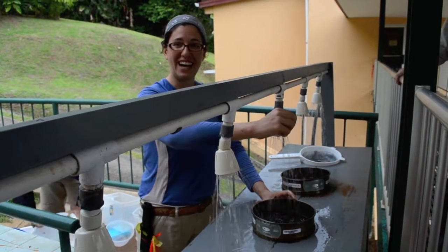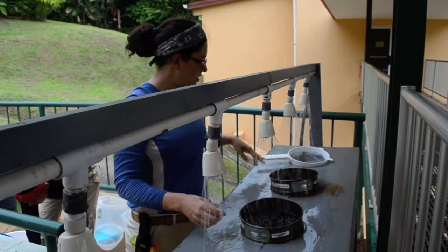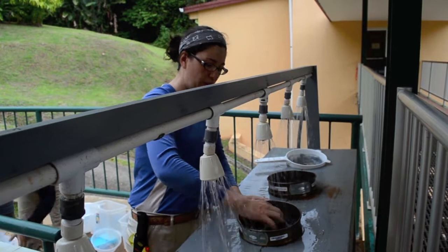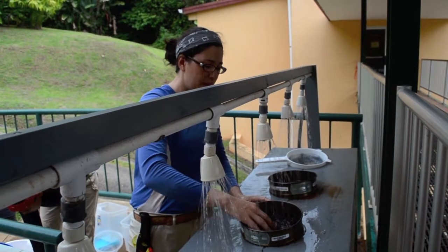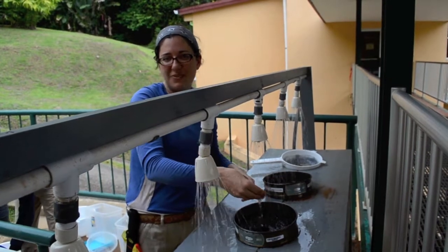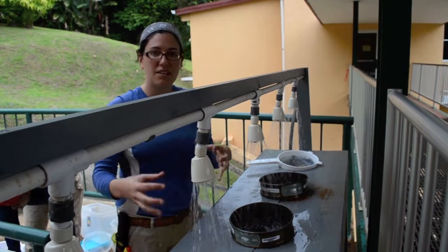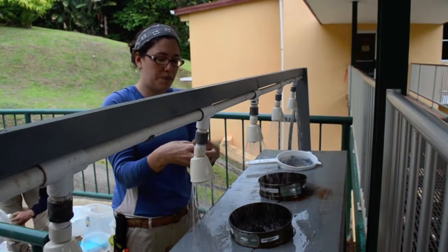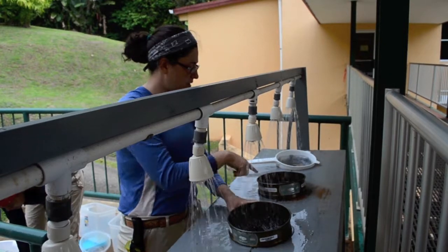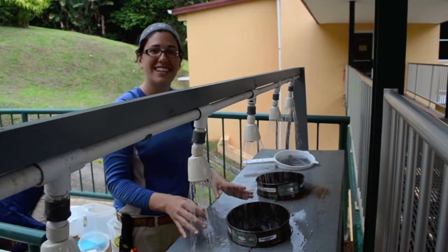These are shower heads, and so these are other samples that are washing as well. And then we let them wash on here for a little while, because the same reason that I had to agitate the sample in that box with the holes in the side is because if there is a ball of small pieces, there could be soil in the middle, and it doesn't have a chance to escape. So this gives all the parts that are not part of the sample the opportunity to leave through the bottom of the sieve.